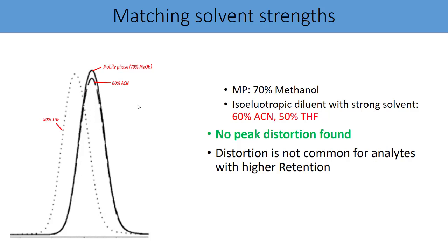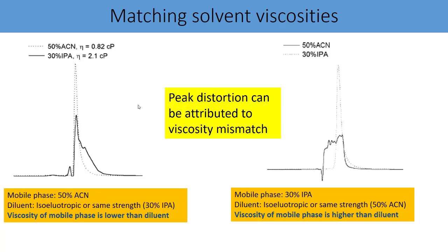Distortion is not common for analytes with higher retention is another important point you must consider. The second important point is about the viscosities now. In the first example onto the left side of the screen, your mobile phase is 50% acetonitrile with the viscosity of 0.82 cp. Your diluent is isoeluotropic, meaning having similar strength but with the viscosity of 2.1 cp.